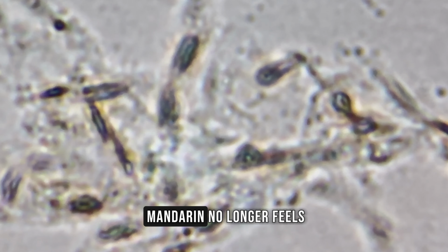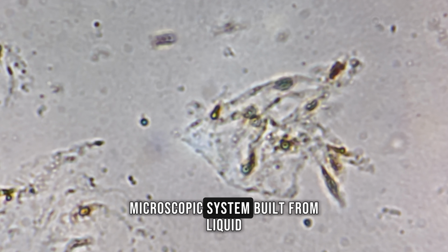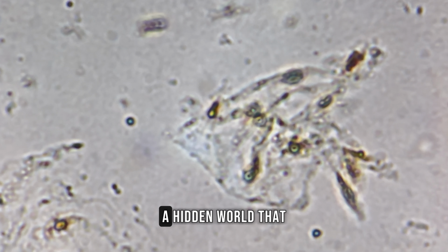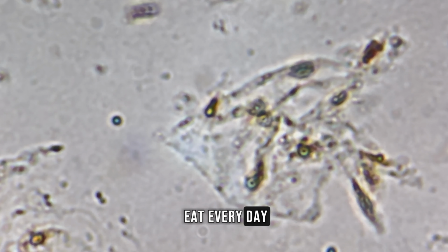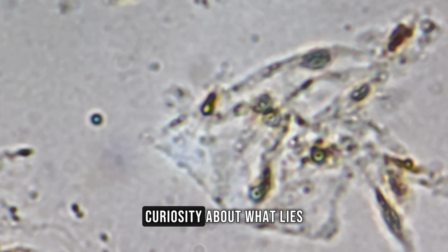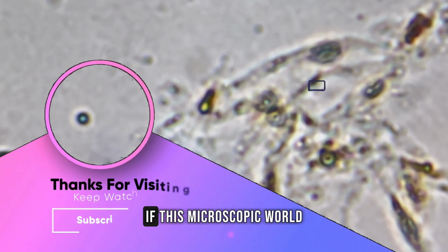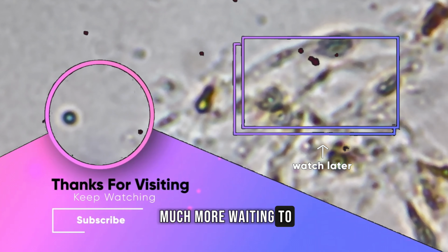At this level, the mandarin no longer feels like food. It looks like a microscopic system built from liquid, fibers, and broken material. A hidden world that exists inside something people eat every day. Seeing this level of detail changes how familiar fruit feels. It invites curiosity about what lies beneath the surface of other everyday foods. If this microscopic world surprised you, there is much more waiting to be discovered.